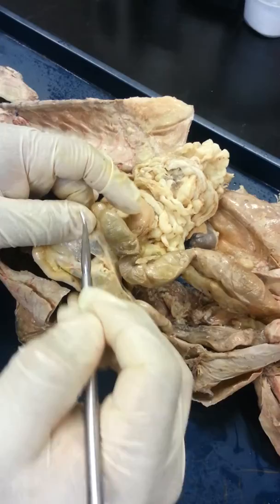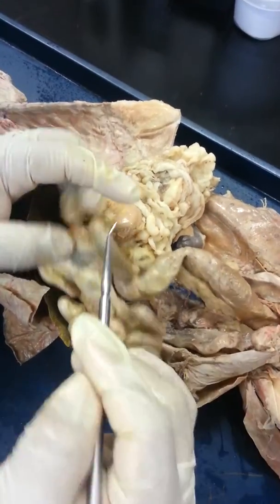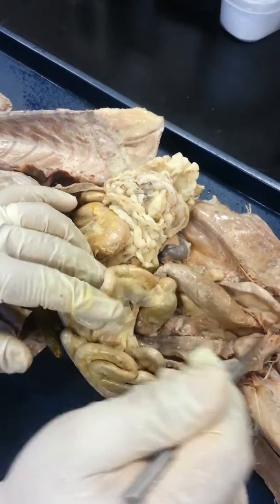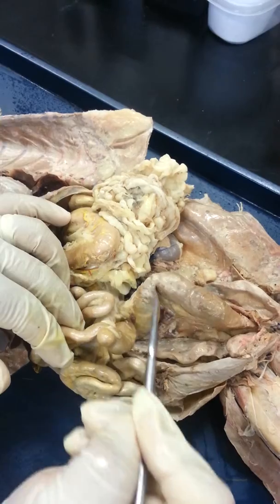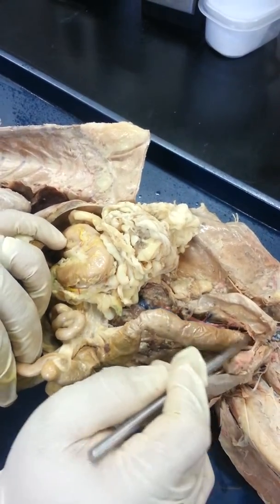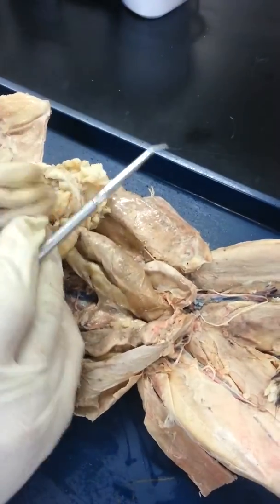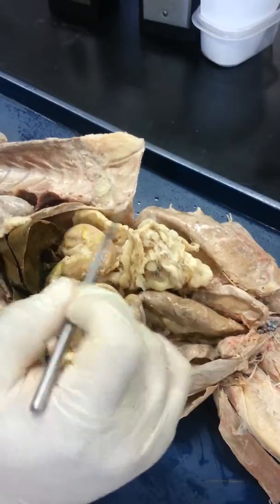Then in humans, you would have the ascending colon, transverse, descending, and sigmoid colon. In cats, it's kind of a straight shape right there. Right? So in cats, if I just ask to name the organ, you could just say the colon. And then, of course, that leads to the rectum, then the anus. And that's pretty much the digestive system and part of the respiratory.